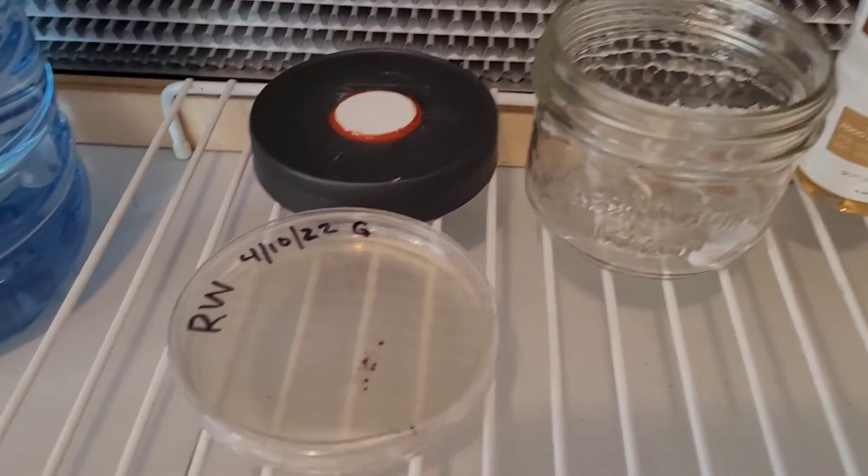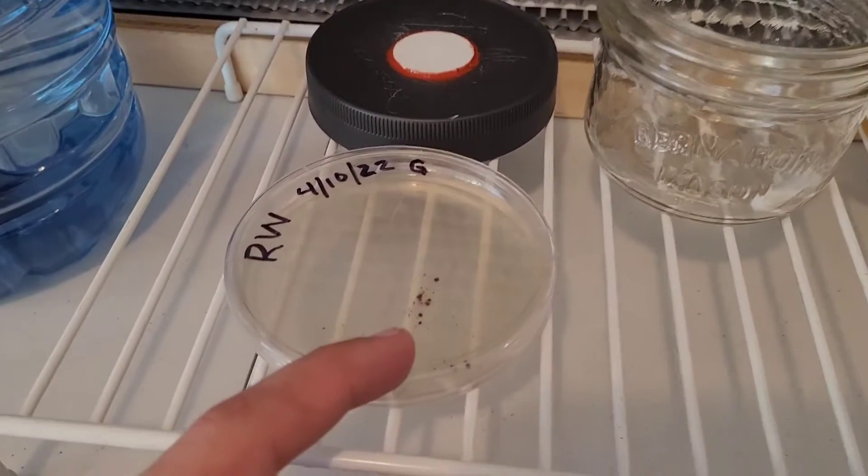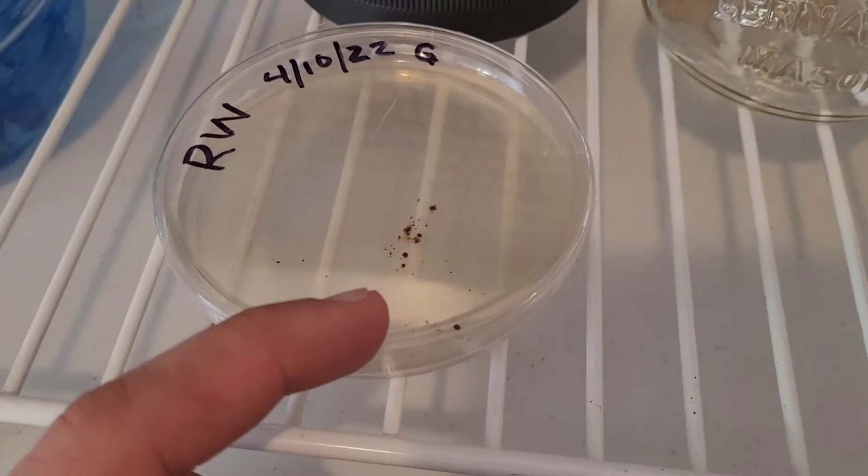Alright, so today I'm going to cover spore rehydration. I have this germ plate here. You can see there's a giant clump of spores on there.